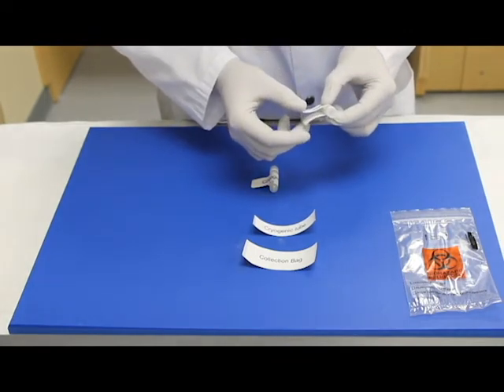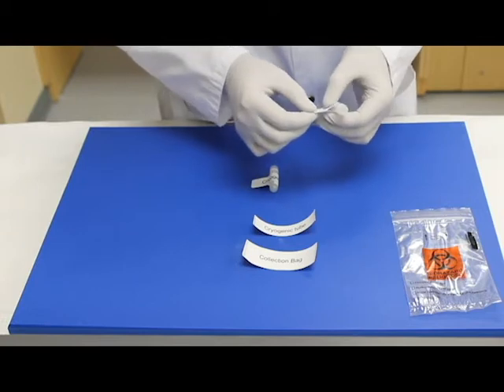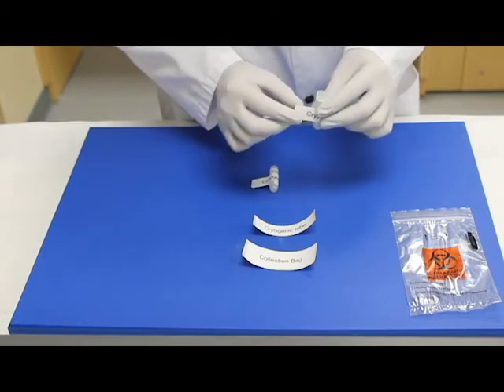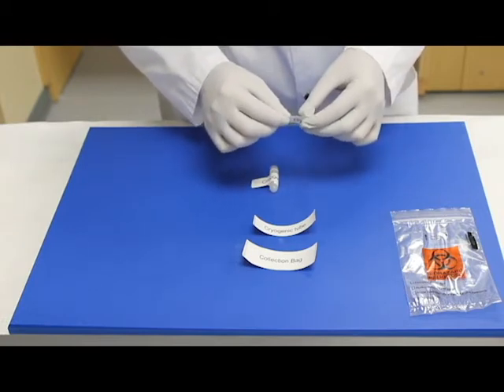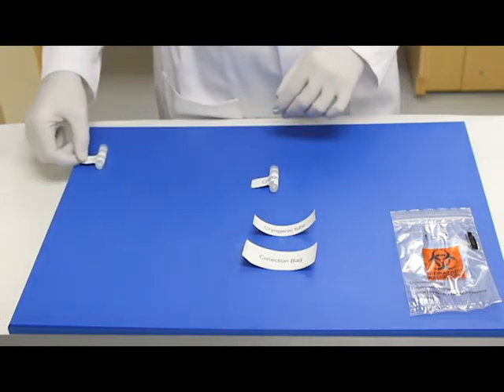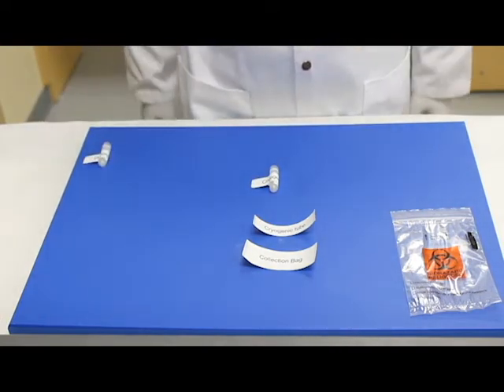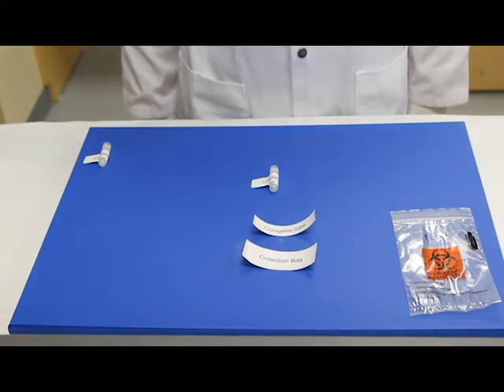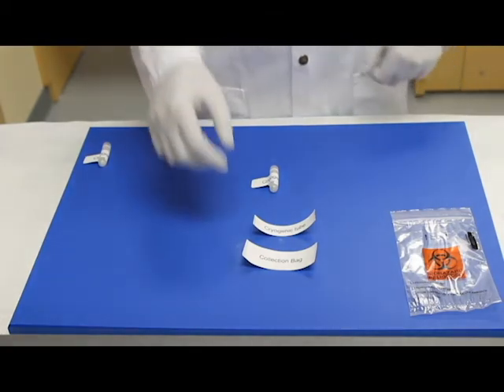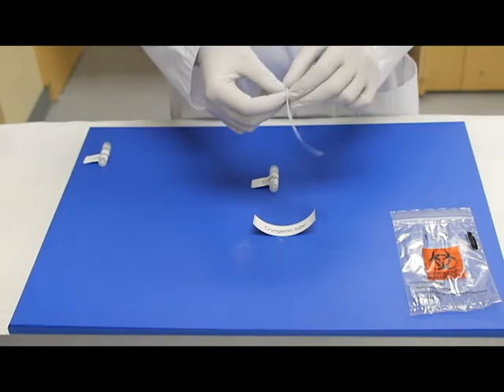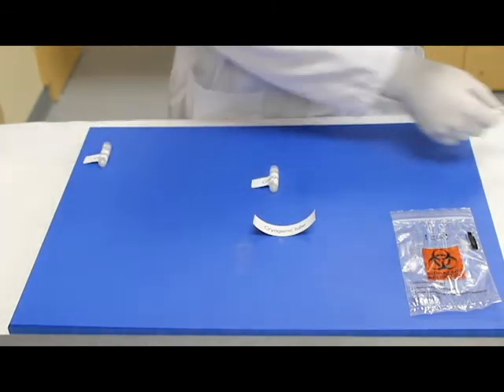Press the label ends together to form a flag. If possible, you can also cover the label with a clear label protective tape to prevent smudging or tearing of the label. Set aside and repeat with the second tube. Once you have your cryovials finished, pre-label your sample hazard bag using the labels provided. Set this aside for later.